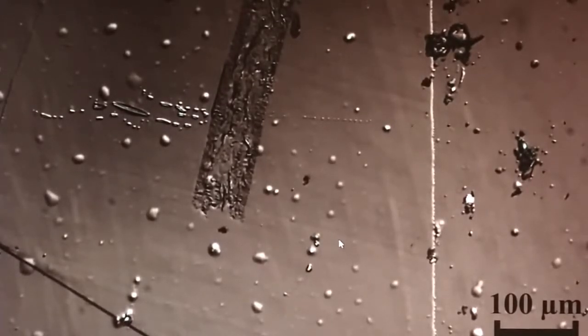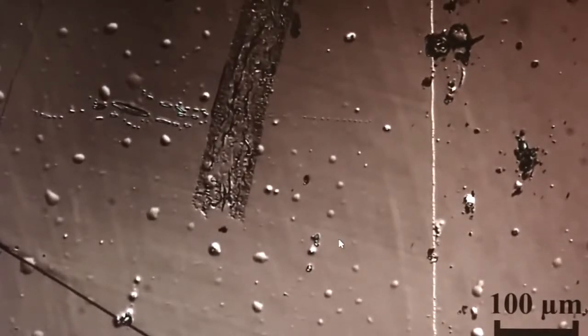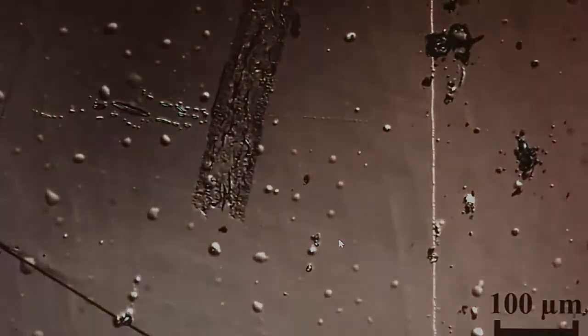You know the small water drop I talked about? They look like small bumps now. This looks like the surface of the moon, sort of. And that feature is the one that you want. And especially if the sample is equally transparent to the light, then this method is the only technique with which you actually can see some contrast. Living cells and things, if you study them, look very nice in differential interference contrast.